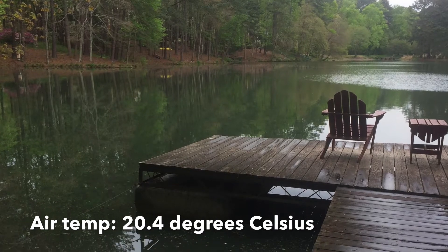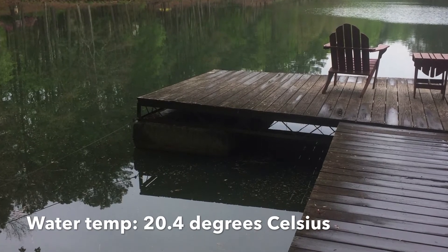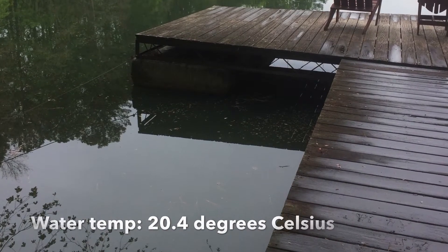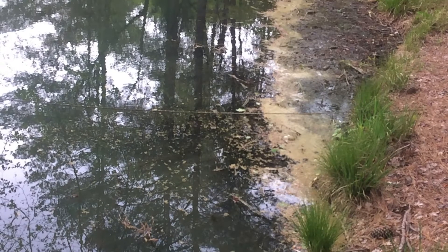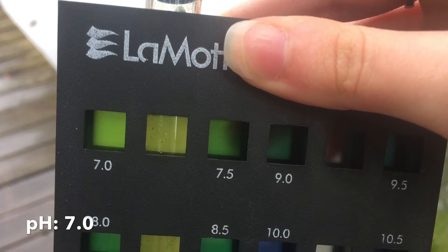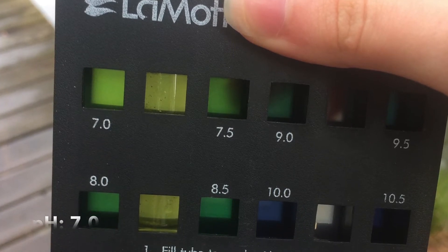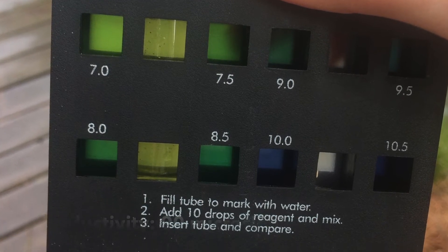My second and final water testing took place on April 11th. I noticed only a slight breeze in the air; it was a bit cloudy and the water was extremely still. I also noticed some debris gathered around the edges of the water. Once again, the pH was 7.0, but the conductivity was slightly lower, and so was the dissolved oxygen level.